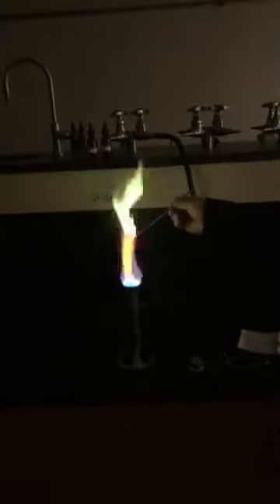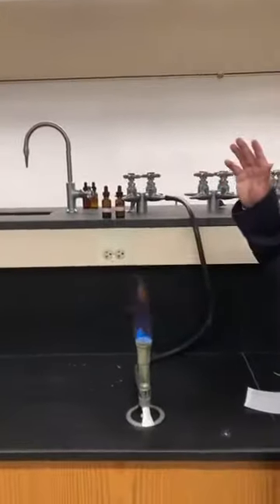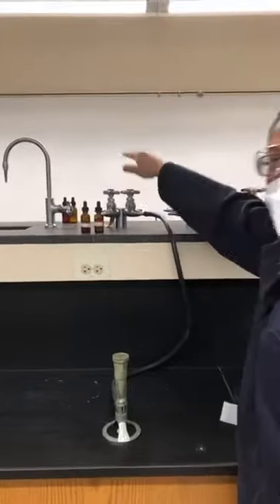Next, I'm trying to do the same using a spatula — let's clean this spatula in ethanol and then touch copper sulfate. I hope this gives you a larger flame to watch. Is that a beautiful green color? I do not want to show you the one for sodium, because sodium gives us a beautiful yellow color — and our flame already seems to have that yellow color from some contamination. So at this moment we're done. To switch off the Bunsen burner, we first need to make sure we close the gas line tightly.